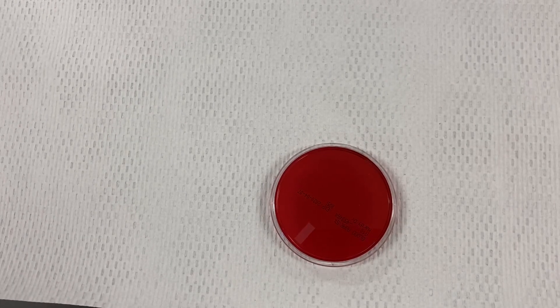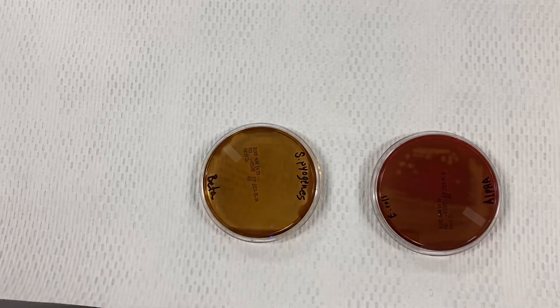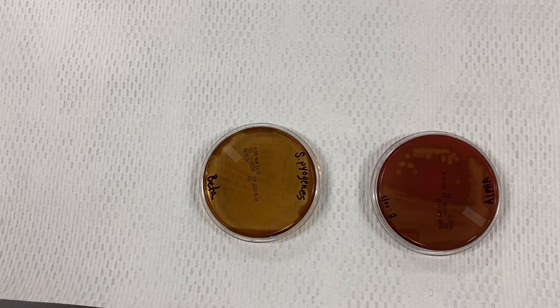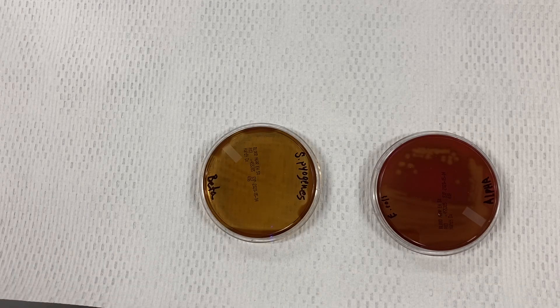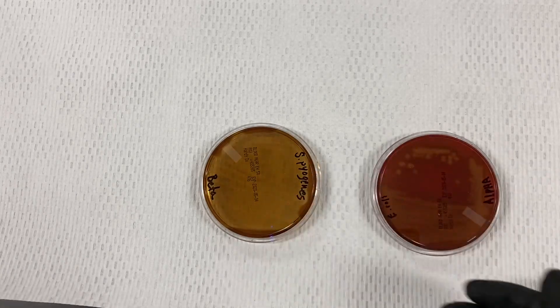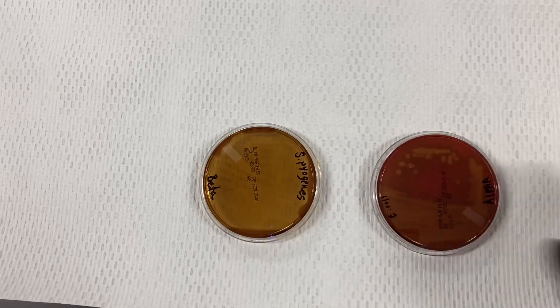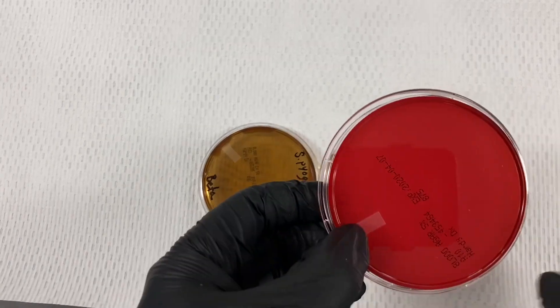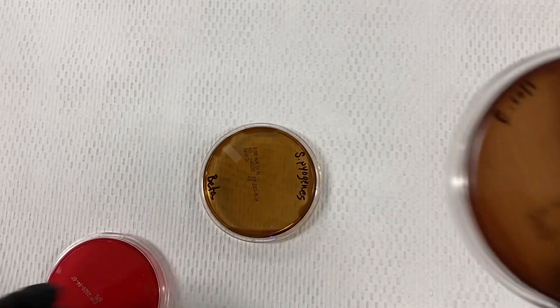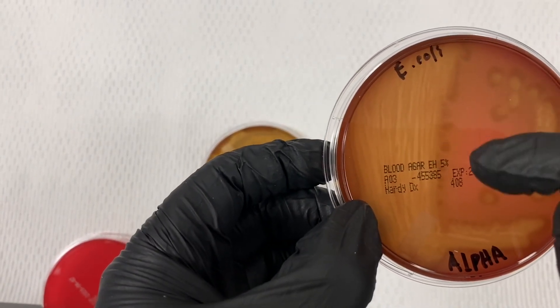For laboratory 25, we started with the original blood agar plates. When inoculated, you can now observe the effect of the organism possessing enzymes called hemolysins. These can perform hemolysis in an incomplete or a more complete manner — partial versus complete — referred to as alpha hemolysis versus beta hemolysis. You can tell from the discoloration of the area versus where blood used to be.